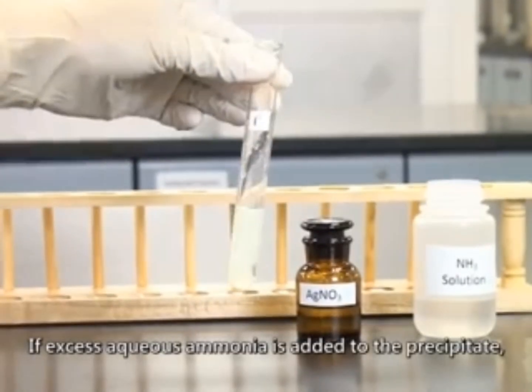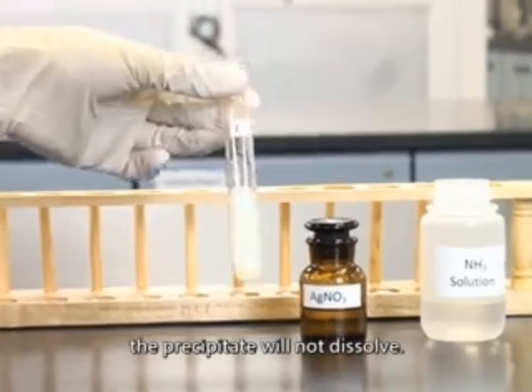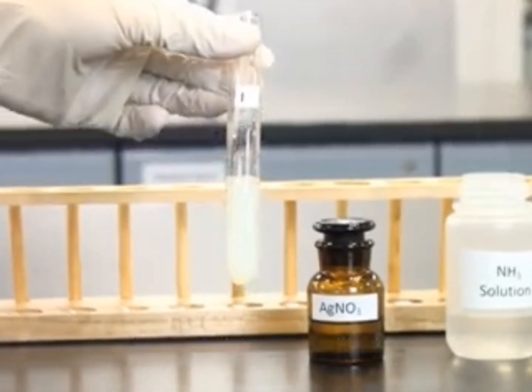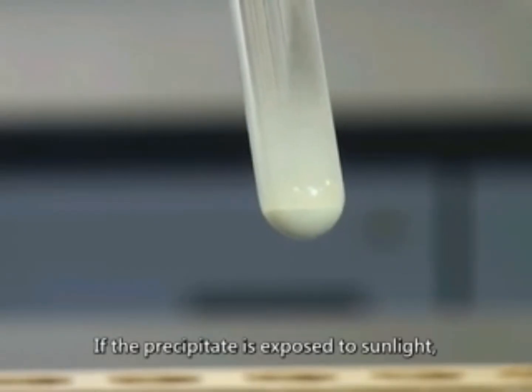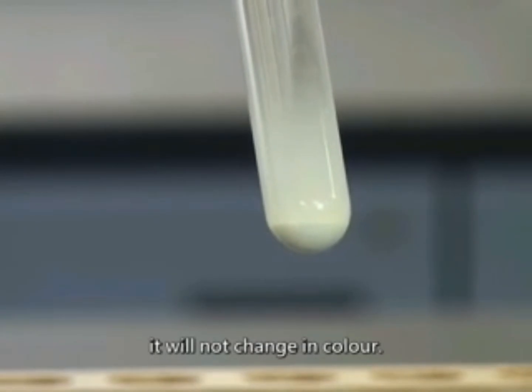If excess aqueous ammonia solution is added, the precipitate will not dissolve. If the precipitate is exposed to sunlight, it will not change in color.